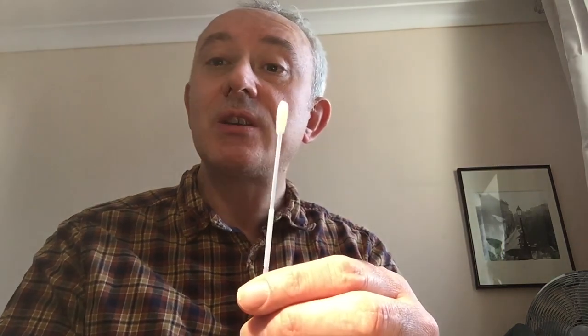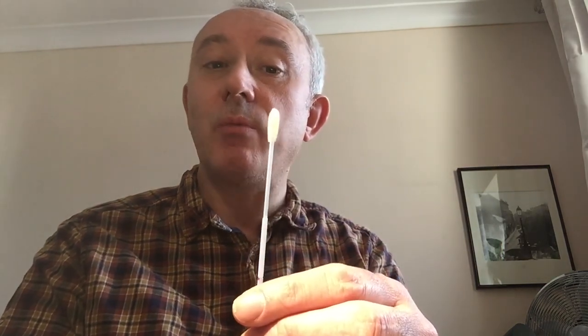There are two different types of swab tip in the way they're made, and quite a range of different materials. First of all there are plain swabs, which tend to be used more in the medical world, and then there are the flocked-tipped swabs.